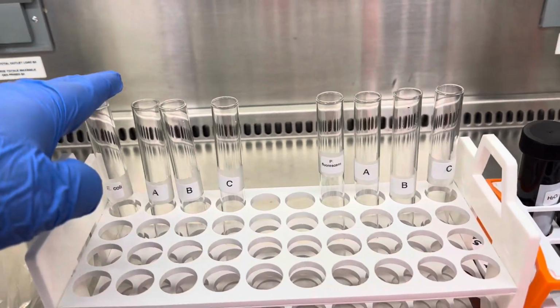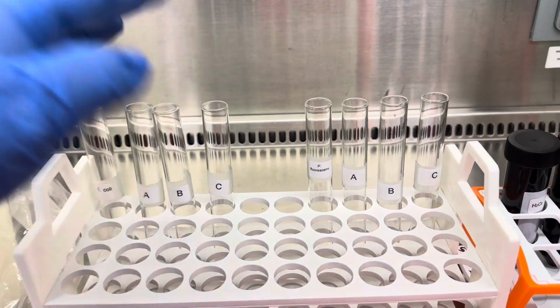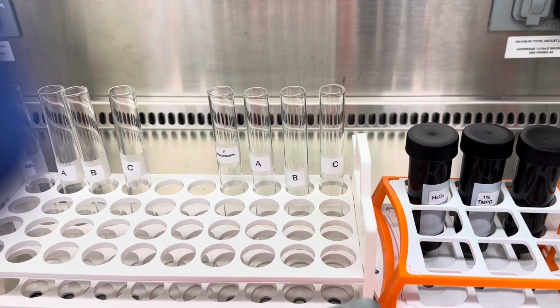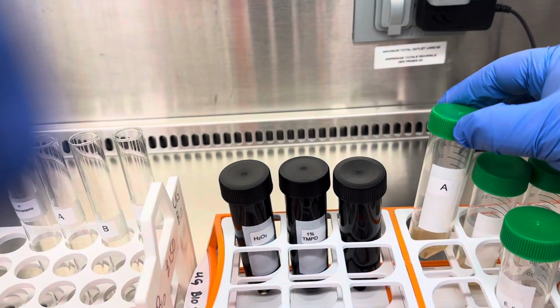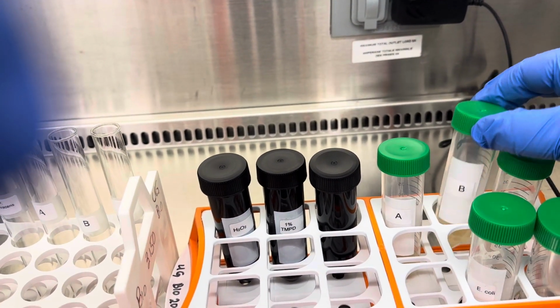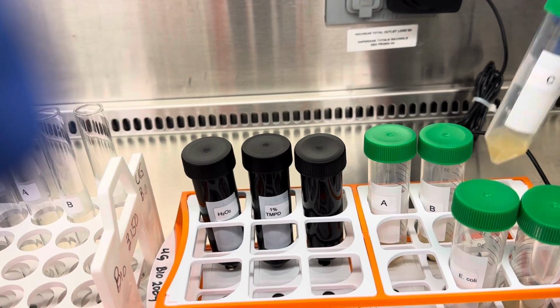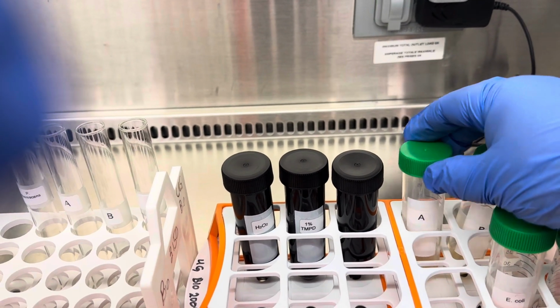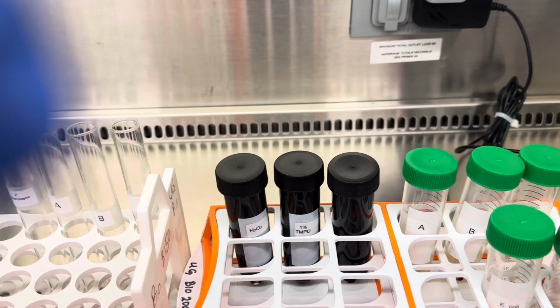So here I have a set of unknowns. Just to clear up what A, B, and C are, those are these cultures here that I isolated using your meat samples. So I took single colonies and I grew them overnight, and as you can see, everything grew bacteria in it, right? And because it's one colony, it's one population of bacteria.